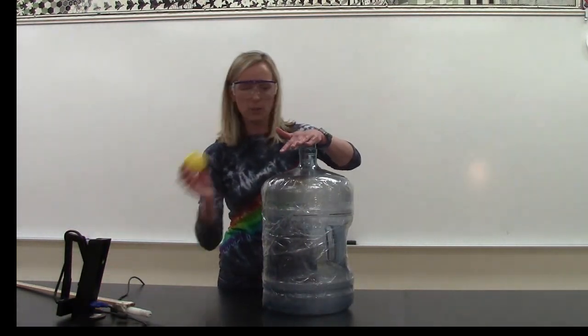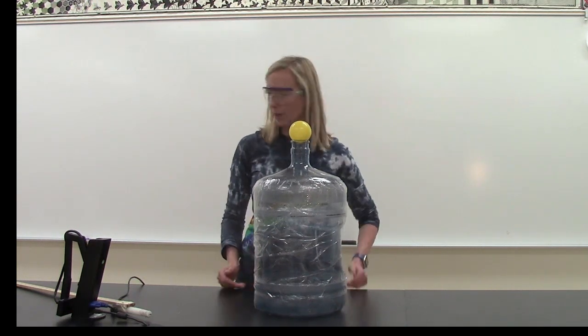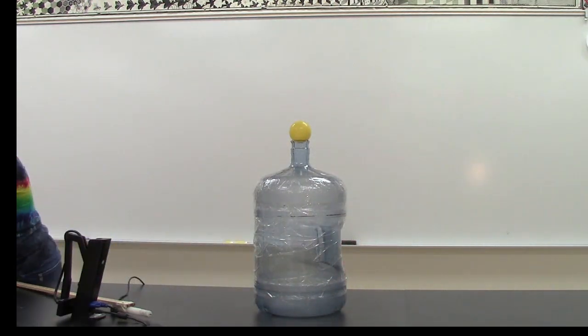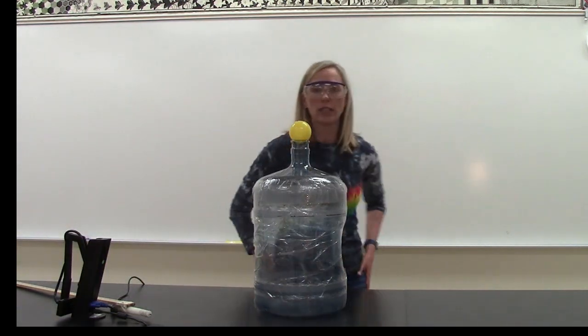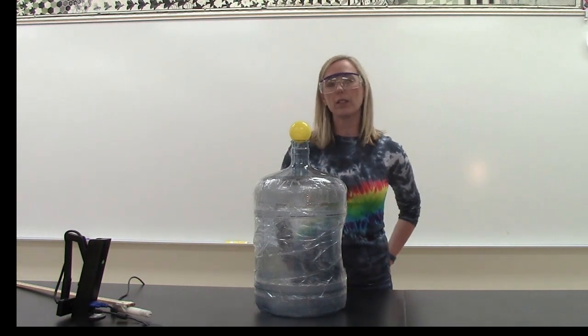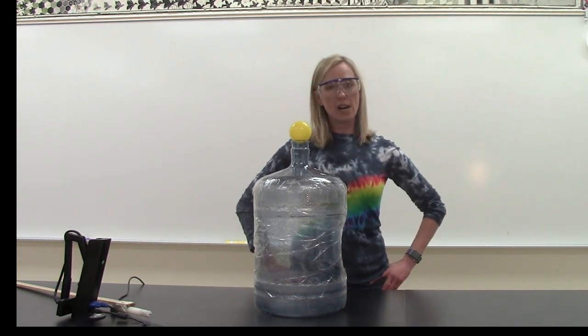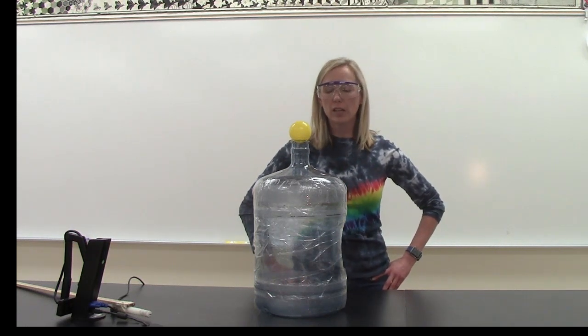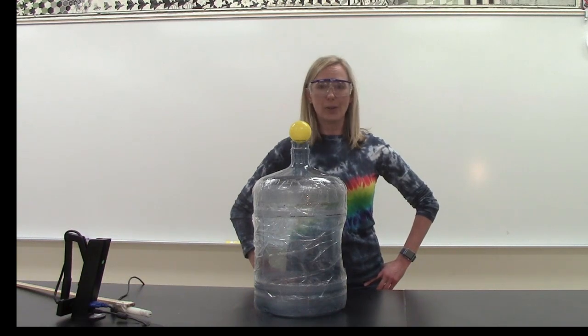While I turn off the lights I'm just going to use a little tiny ball to kind of prevent any of the vapor from coming out. I just washed any excess liquid that might be on my hand. I'm going to turn off a little bit of the lights. I'm going to light a candle and then we're going to ignite the very tippy top of the bottle and the ethanol vapors are going to light on fire. So let's take a look at how this goes.